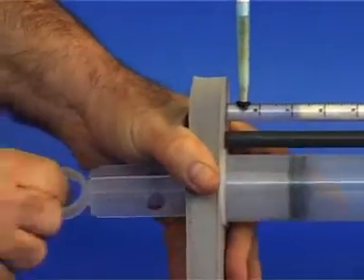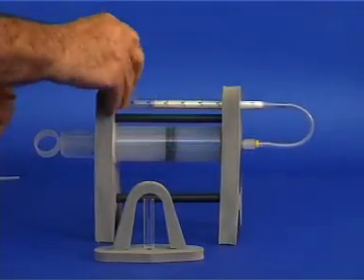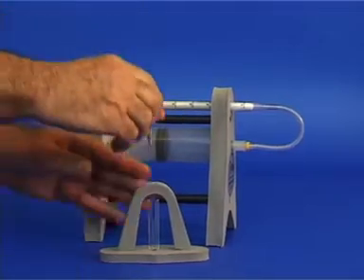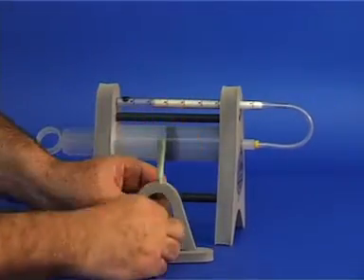Now remove the cigarette and put it aside in a cup of water. Take the filter holder, insert a small test tube on the bottom and the cotton filter inside the filter holder opening.